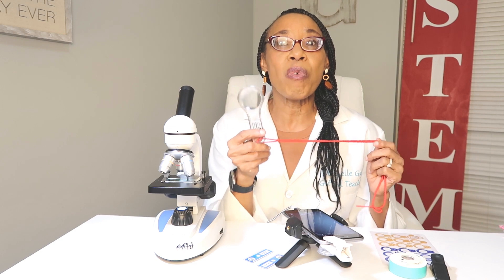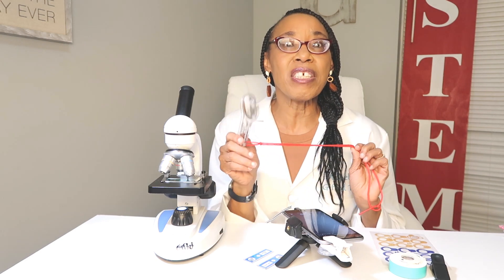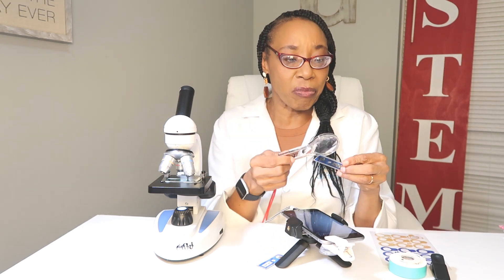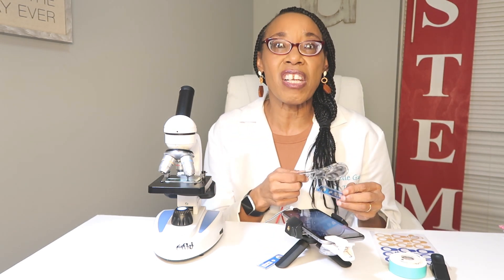There are two different types of microscopes. One is called the simple microscope because it only has one lens, which is like a magnifying lens. Have you used a magnifying lens before? If you put it up against something and look, you can enlarge the print.